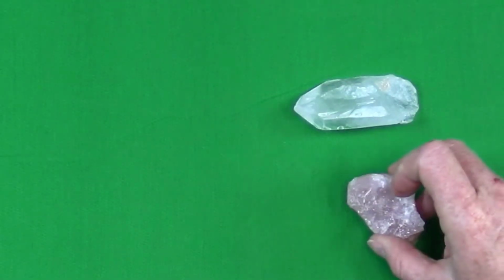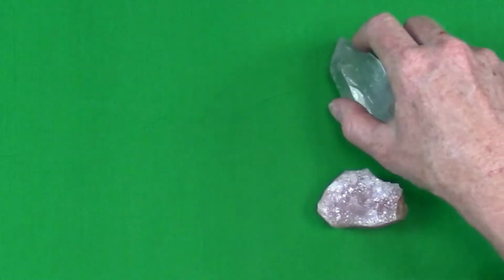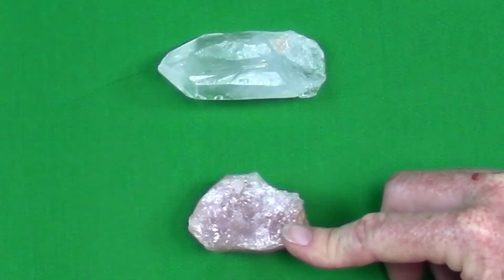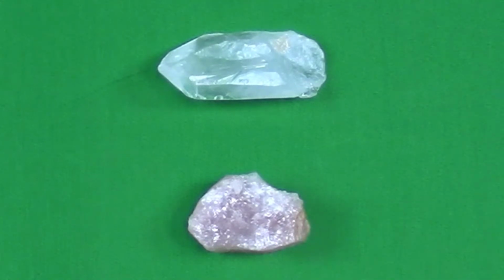So when you're trying to describe or identify minerals, one of the first things we might think about is the color of the mineral. Color for some minerals can be useful, but both of these minerals are samples of quartz. Quartz comes in many different colors: clear or white, pink, purple, gray, yellow, lots of different colors. So color can be not a very descriptive property test.